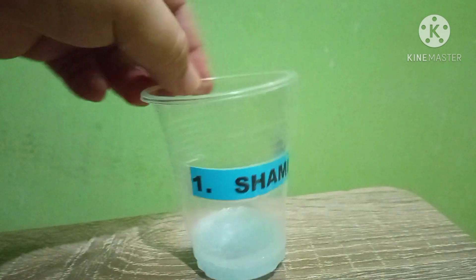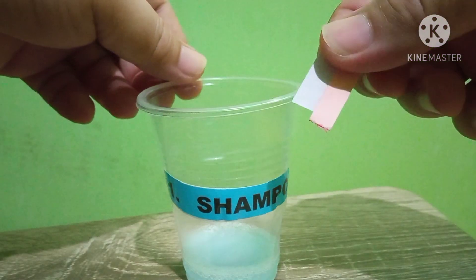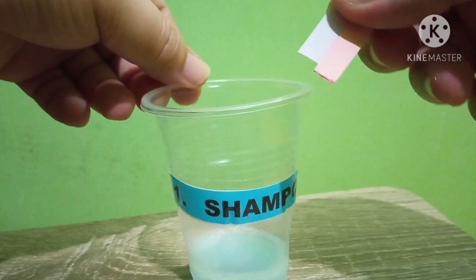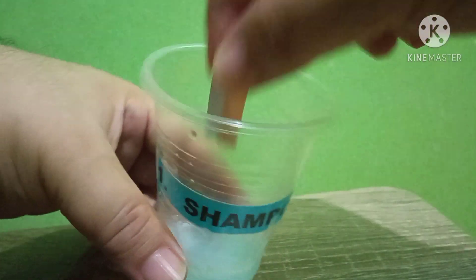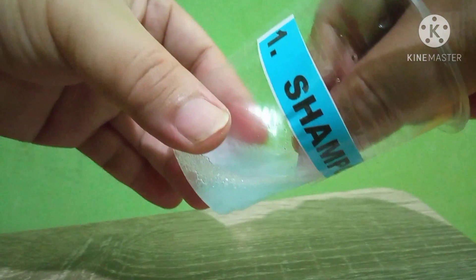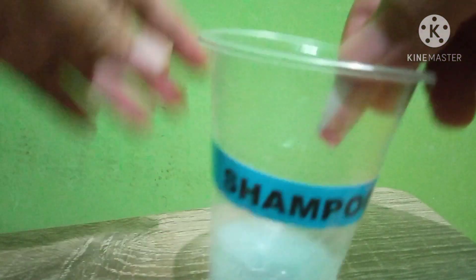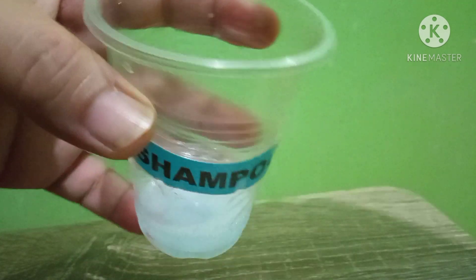Solution number one is Shampoo. We will use two litmus papers — the blue and the red. Let's dip them in. Let's check — okay, both are turning blue. So shampoo is basic.